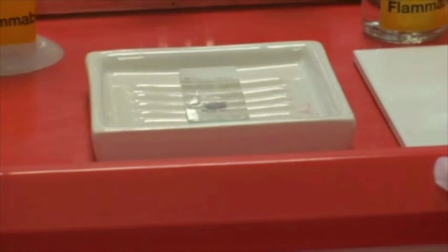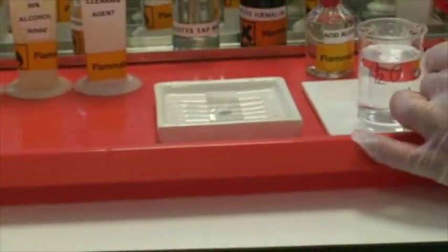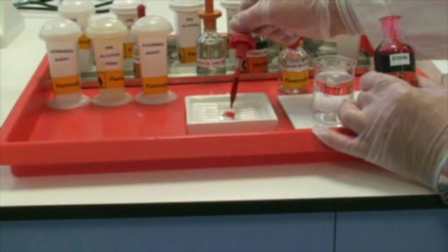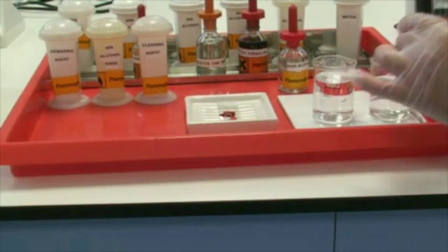We're now going to stain with Eosin for two minutes. I'm just filling the container at this present moment, ready to run it onto the slide. We will now stain for two minutes with Eosin.